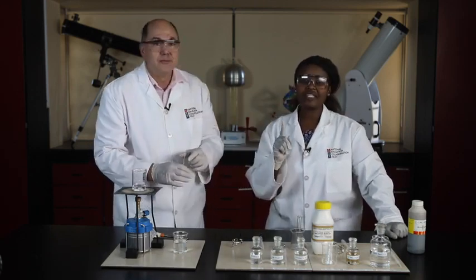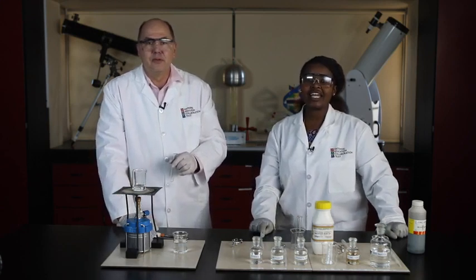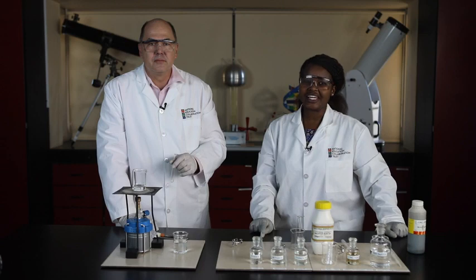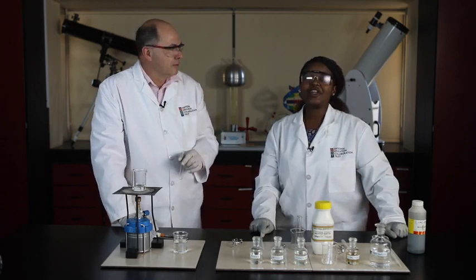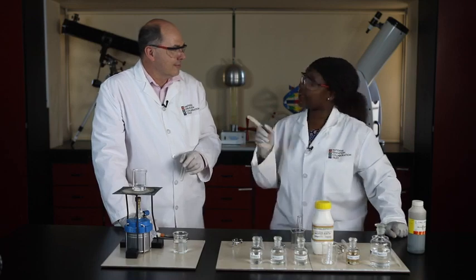Before that, learners, you should record the fragrance of this ester formed by the reaction of ethanol and ethanoic acid. Later on, you can complete the other questions on the worksheet, but meanwhile, we are moving on to prepare another ester.